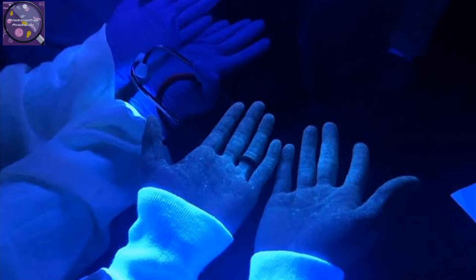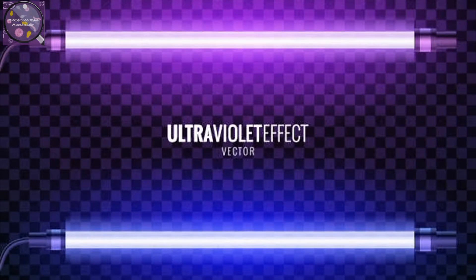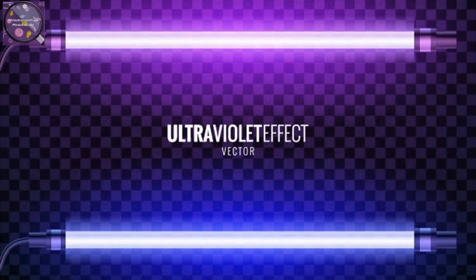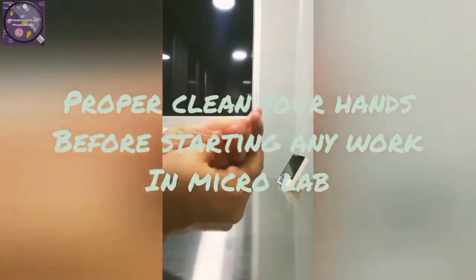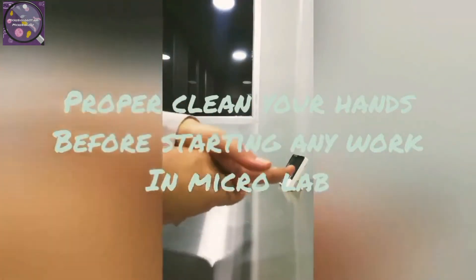It is recommended that UV lamp exposure be avoided. Special safety precautions need to be in place for protection of personnel, products, and materials, as there is a potential for misuse of UV lamps with resulting injuries and deleterious effects.